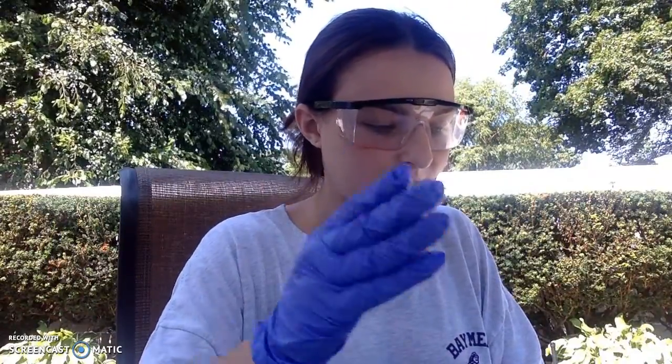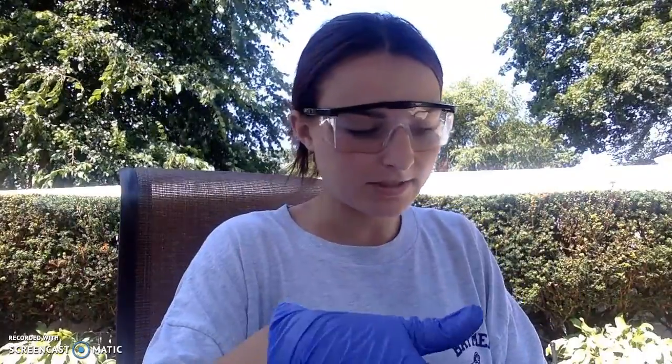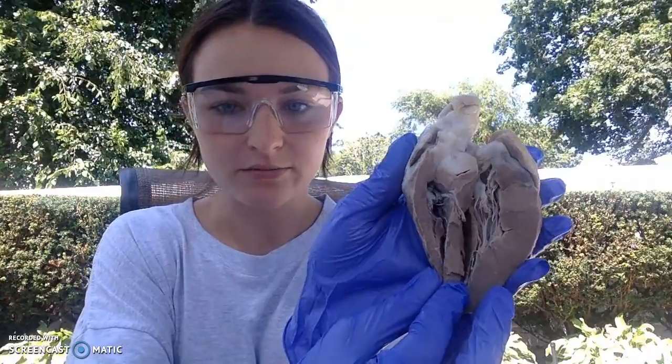So when you first take the heart out of the package, it's surrounded in a lot of this white substance, which is a protective layer of fat around the heart. Unfortunately, I made the mistake of making a sagittal cut down the heart. I was able to salvage that and do a frontal cut to get a better view of each of the compartments of the heart, but now I have 4 separate heart pieces, so bear with me as I try to show this. So here is the interior portion of the heart.